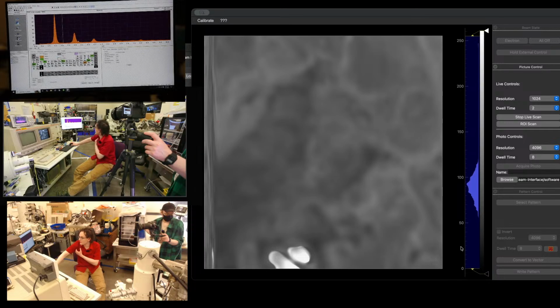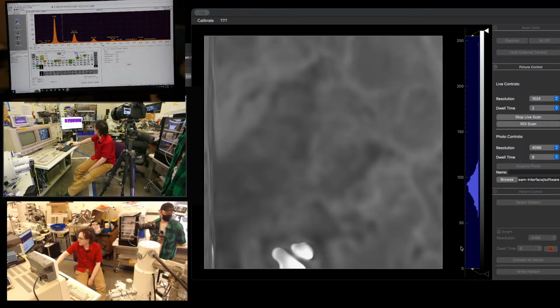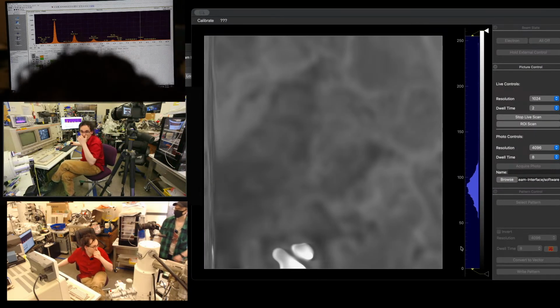There we go. Yeah, big old aluminum peak. That might be a gold peak. No, that's probably not a gold peak. Yeah, I'm just seeing aluminum across the board there. A little bit of copper, probably. But alumina has a lot of peaks that stack on top of each other in kind of weird ways, so.